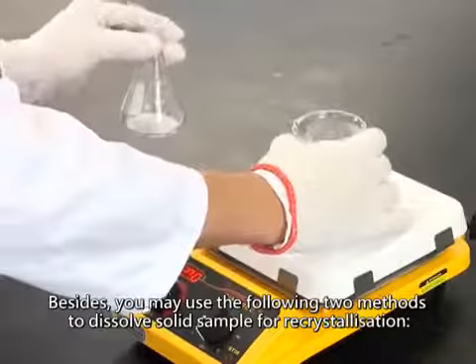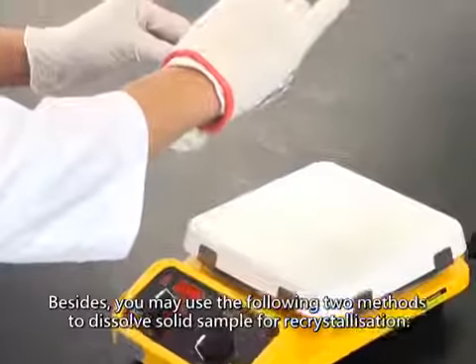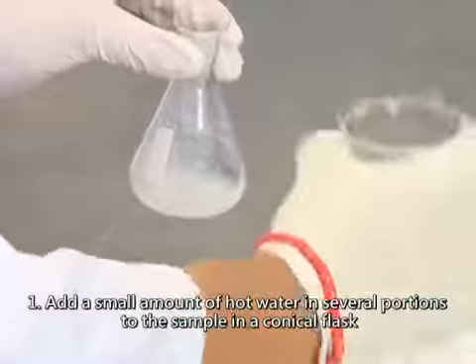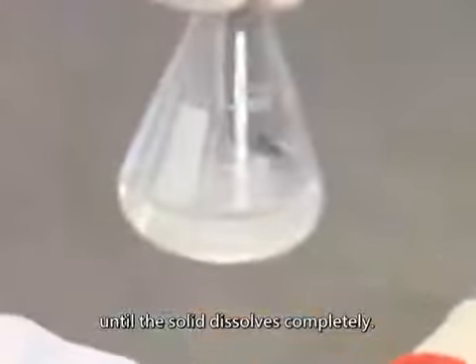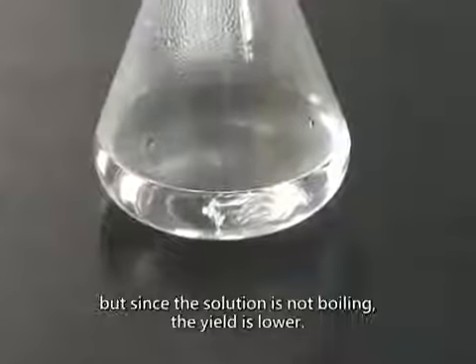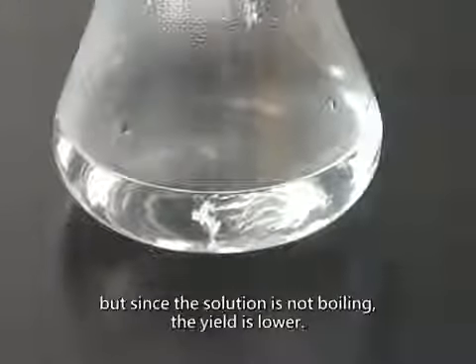Besides, you may use the following two methods to dissolve solid sample for recrystallization. Add a small amount of hot water in several portions to sample in a conical flask until the solid dissolves completely. This method is simpler, but since the solution is not boiling, the yield is lower.